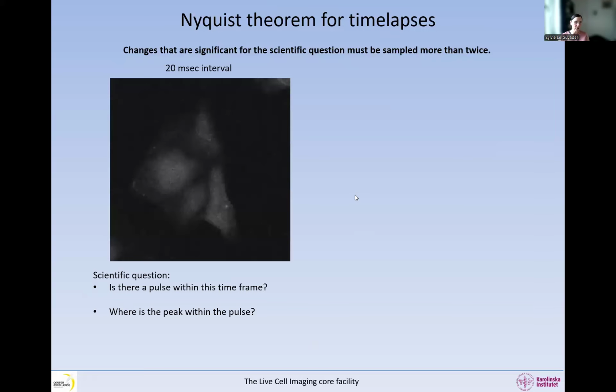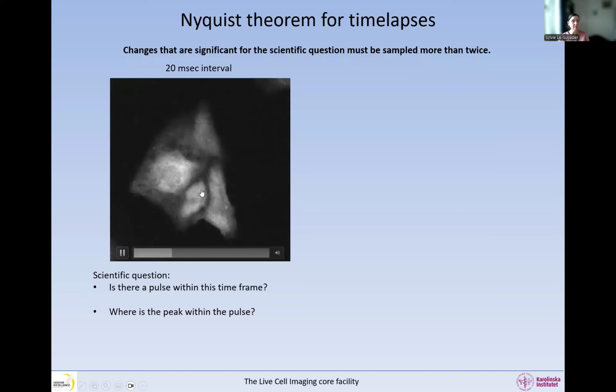So here is an example. We have beating cardiomyocytes, and this is what they look like if my movie starts. Yes, so this is what they look like, and they are pulsing, and we have a calcium sensor in there, so we can see the calcium pulses. So in here, I have a 20 millisecond interval, so I am imaging very, very often. I'm imaging 50 times per second, so 20 milliseconds in between the images. And let's say I have 2 scientific questions. One of them is, is there a pulse within this time frame, within the time I'm recording the whole movie? Is there a pulse of calcium or not? And the second scientific question is, where is the peak of the pulse? Because it goes up slowly, and we can say here maybe is the peak, and then it goes down. So I have these 2 scientific questions.